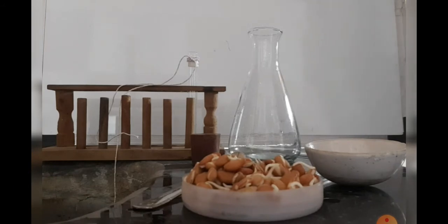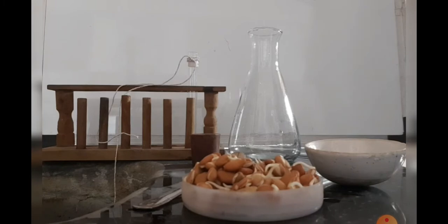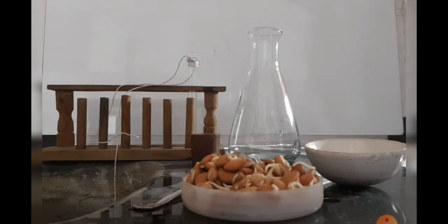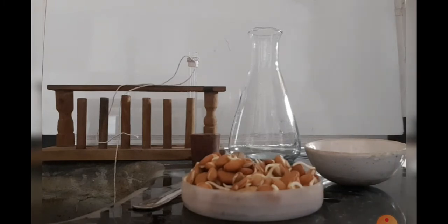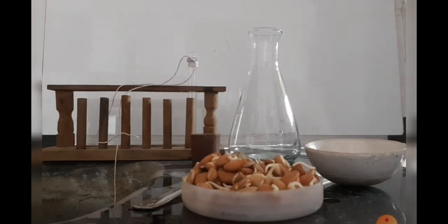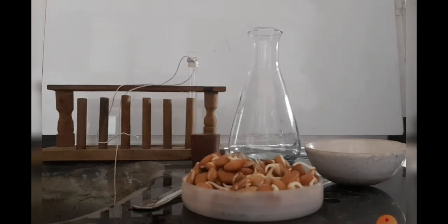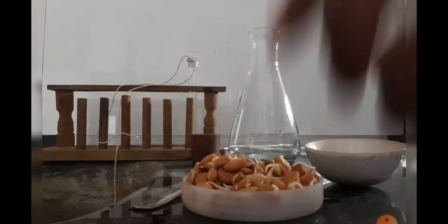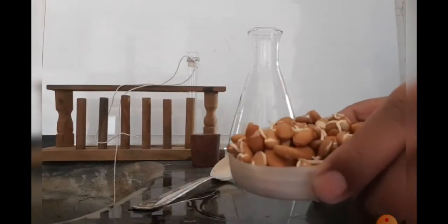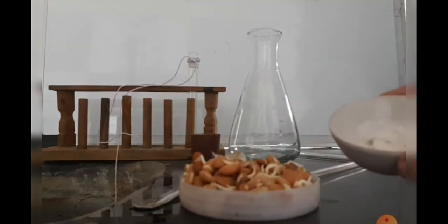Today we are going to perform an activity to show that carbon dioxide is evolved in the process of respiration. For this activity, the materials which are required for this practical are sprouted beans.